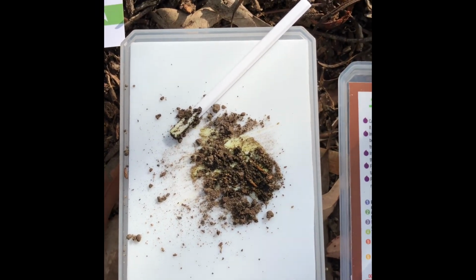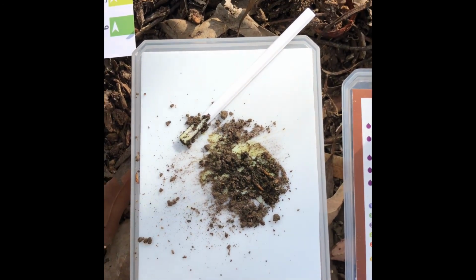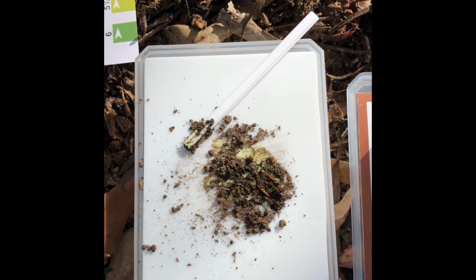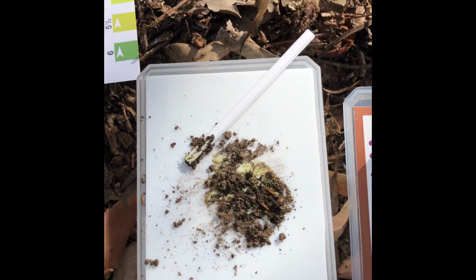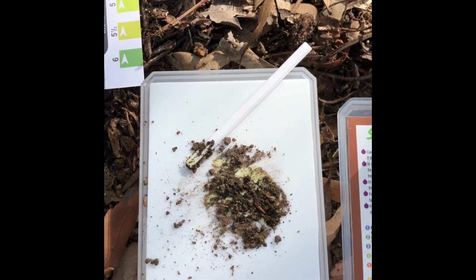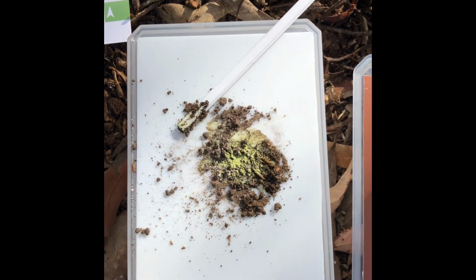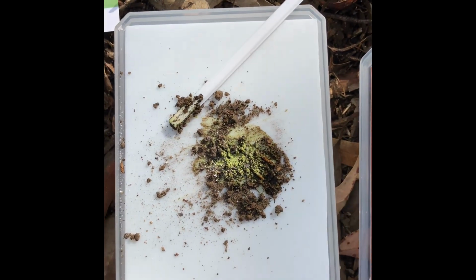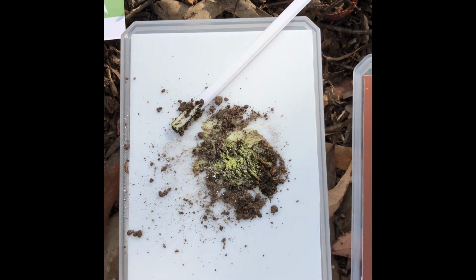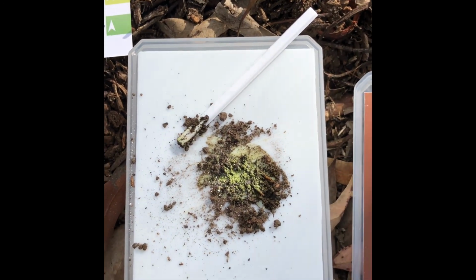Now, as you can see, I've made a nice wet paste by mixing in enough drops of that indicator liquid that the dirt is now wet and there's a color that I can see. The last thing I need to do is add some of the white barium sulfate powder that will make that color stand out so I can use the chart to work out what the pH is. Now I've dusted the barium powder into that soil and you can see that there's a nice green color change. That colored powder is what I'm going to use my pH indicator chart on to determine what pH it is.